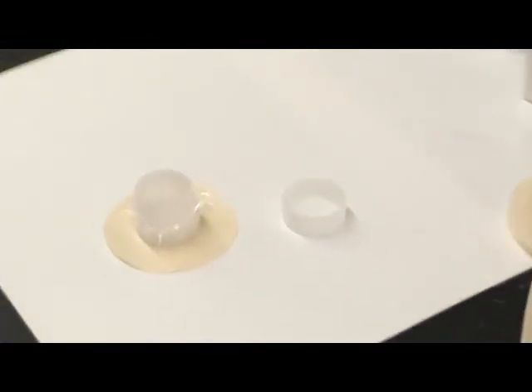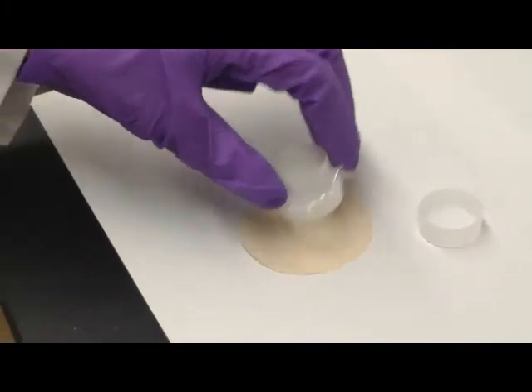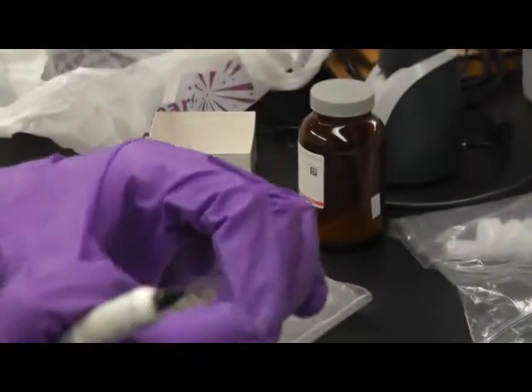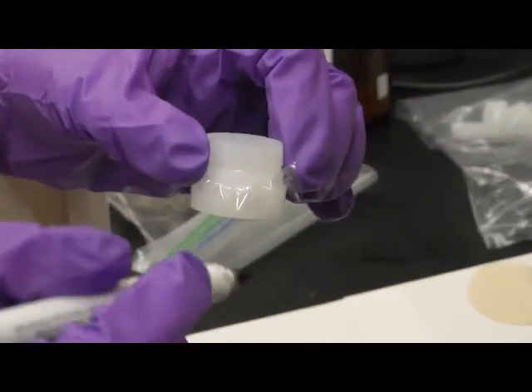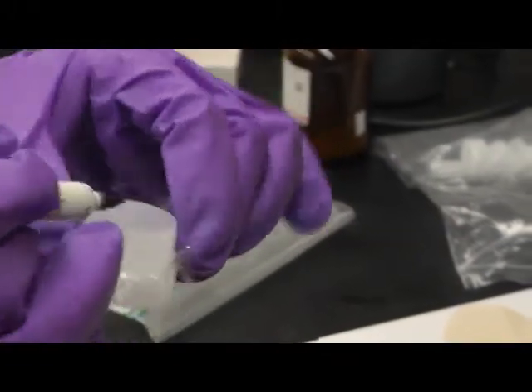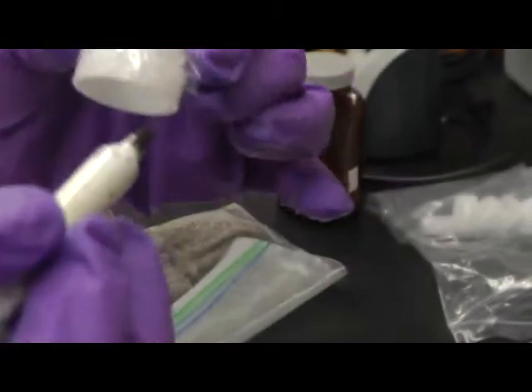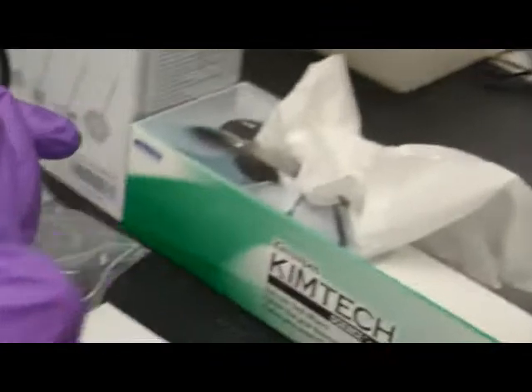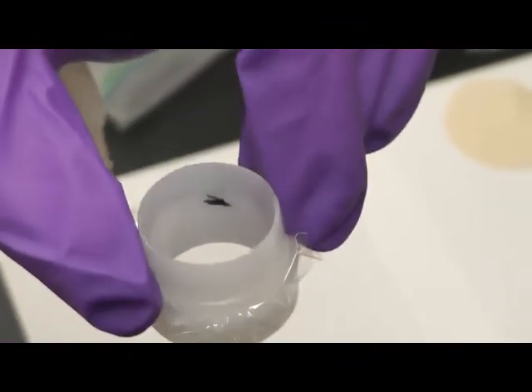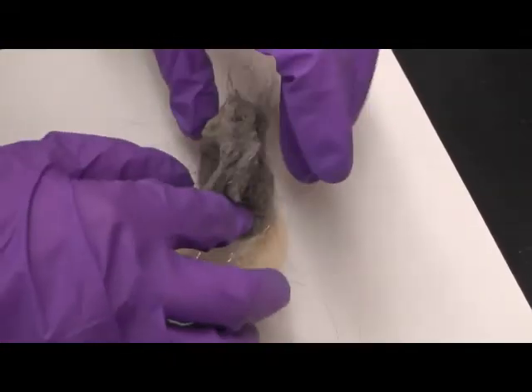The difficulty of making dust cups is that we cannot measure dust as we measured soil. So we generally have to pack dust really tightly into the cups. And we generally will tightly pack the dust until it reaches at least half of the total height of the XRF cups. And therefore we make a mark of the half height. And we just stuff dust samples in.